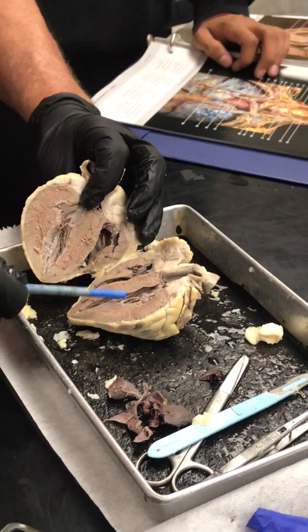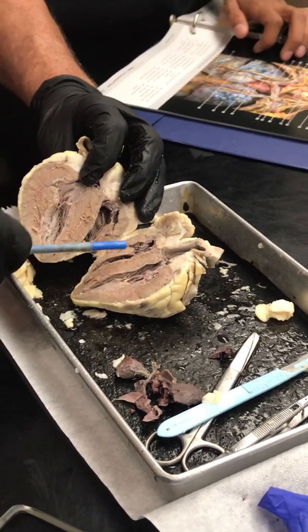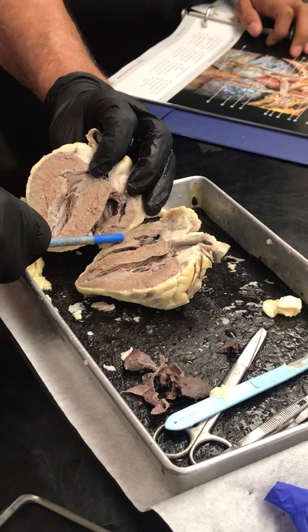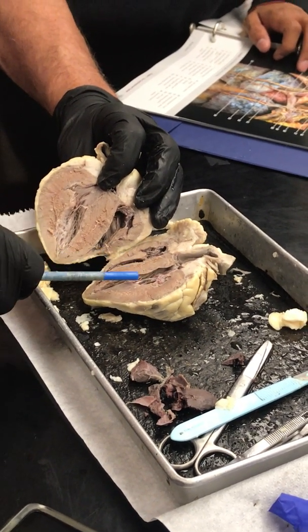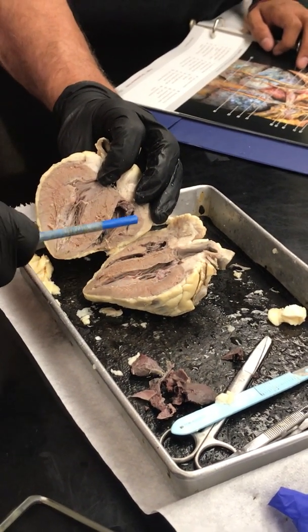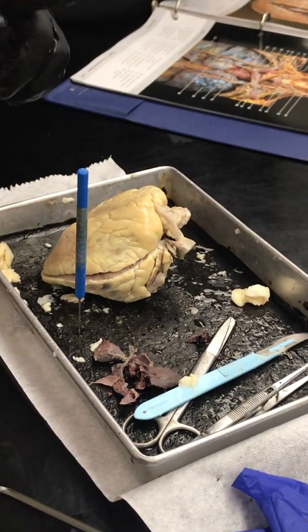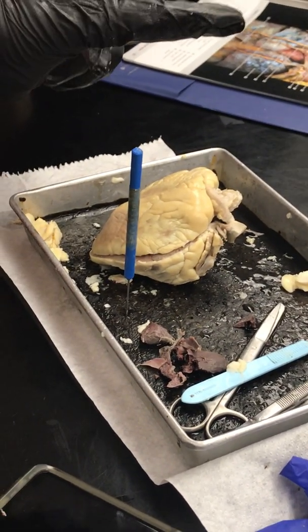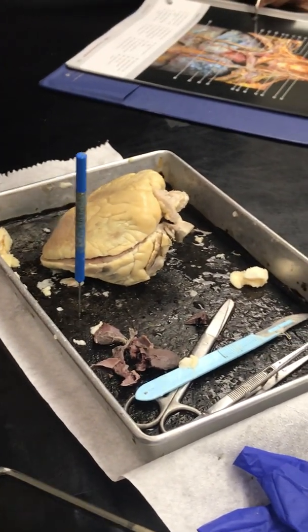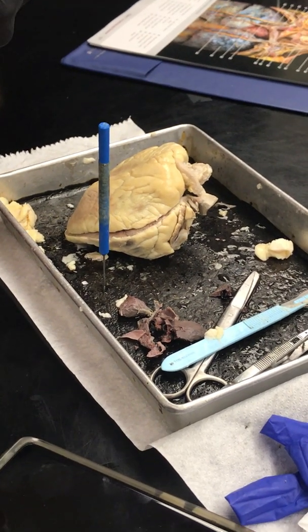Okay. The difference between the right and the left that you know of is because the right side has a thin-walled membrane here, the myocardium. The left ventricle has a thick wall because it needs to push. It's a lot easier to push blood to the lungs than it is systemically. So the contraction of the myocardium needs to be stronger on the left side because of arterial pressure.